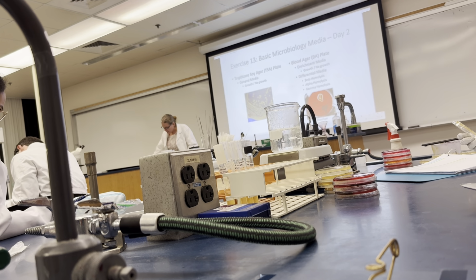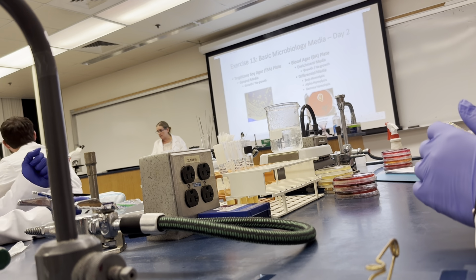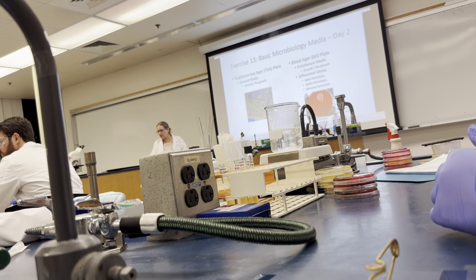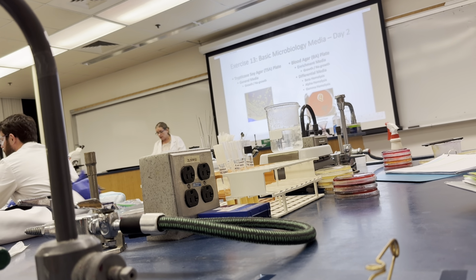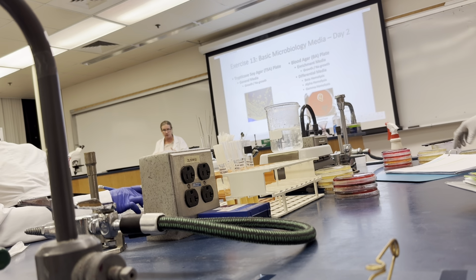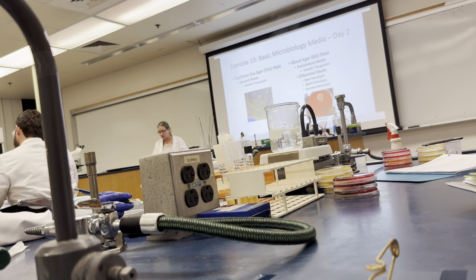Salmonella enterica and Escherichia coli are alpha hemolysis. Staphylococcus epidermidis is gamma. And then Staphylococcus aureus is beta. So alpha, alpha, beta, gamma. In this case, the interpretation is all four of these organisms can grow on this enrichment media. And then the differential: the observation is the green tone haloing, the clear haloing, no haloing, versus the interpretation, which is alpha hemolysis, beta hemolysis, gamma hemolysis.